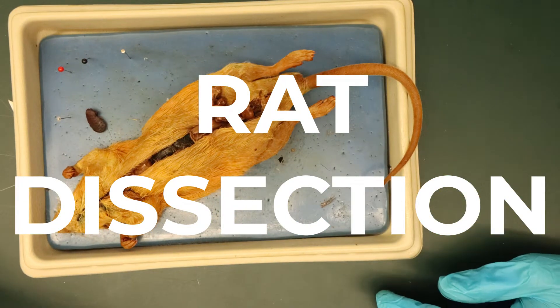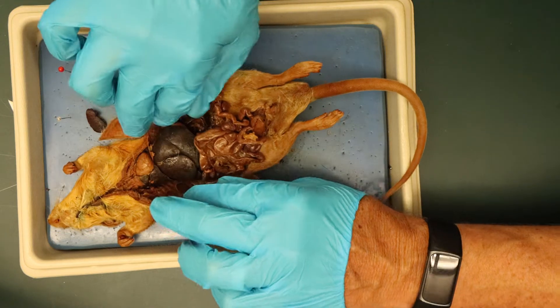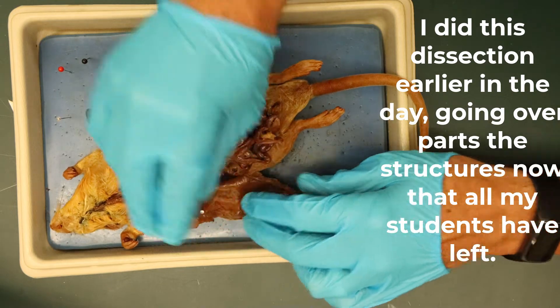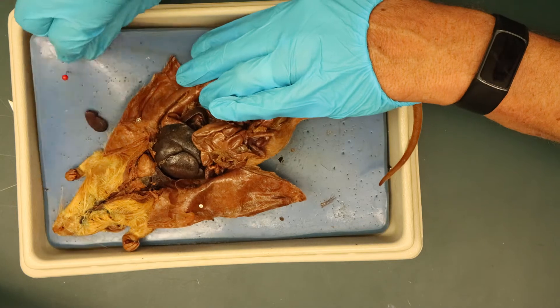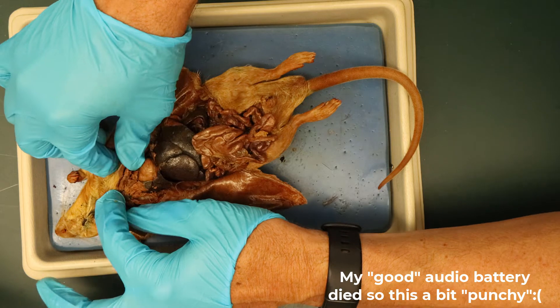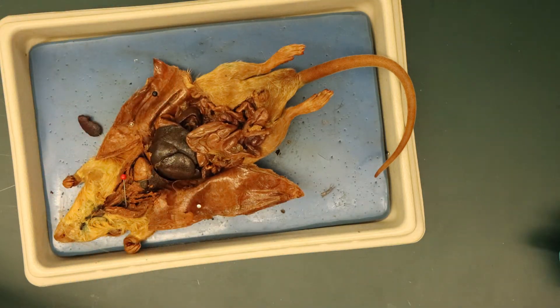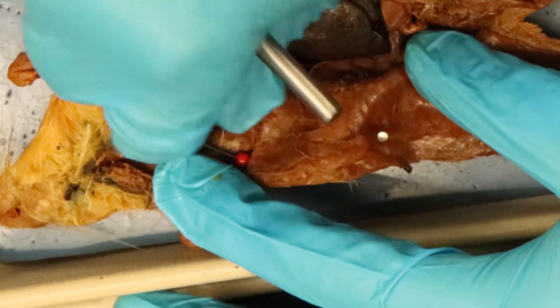This is the rat dissection — I'll walk you through it. It has already been dissected and opened up, so what I'm going to do first is pin the skin back like this and open it up so we can see what's inside. In this particular case we're going to look at some structures up in the throat area, so I'm going to open that up as well. Now let's go through and see.